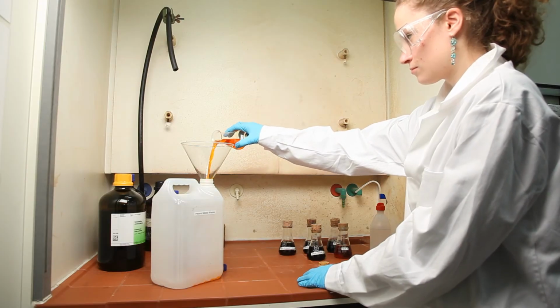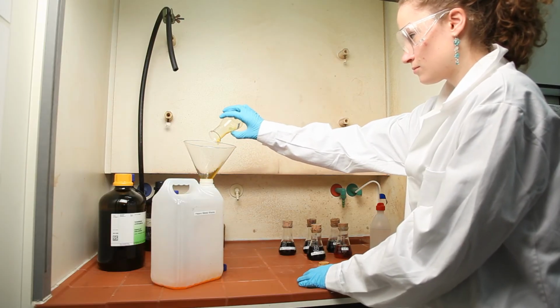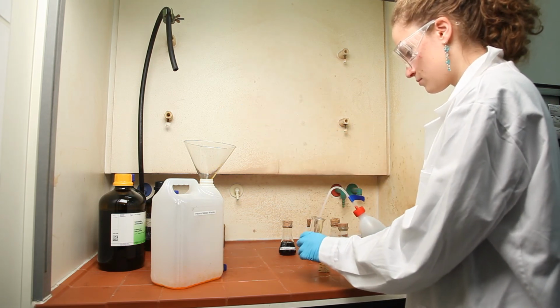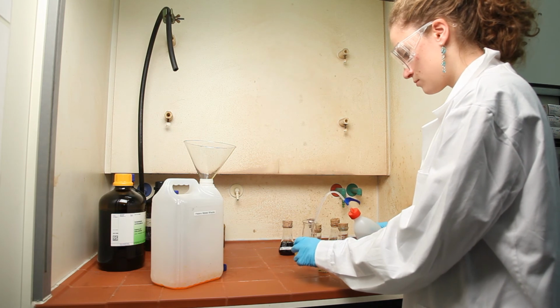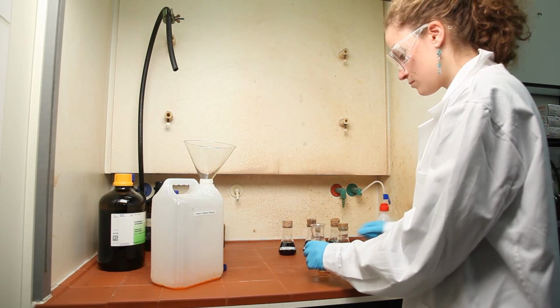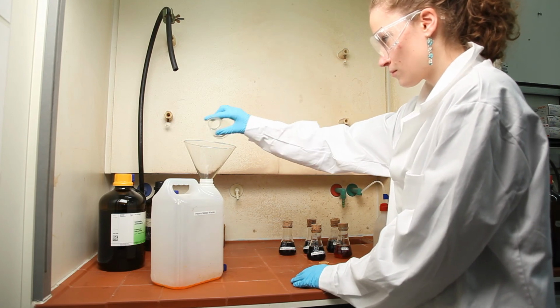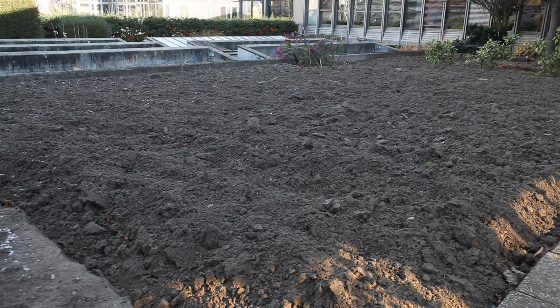After the measurements, the chromium solution is still toxic and corrosive. It is collected and disposed professionally. Data on the humus content of the soil help to answer many questions related to fertilization, land use, and soil remediation.